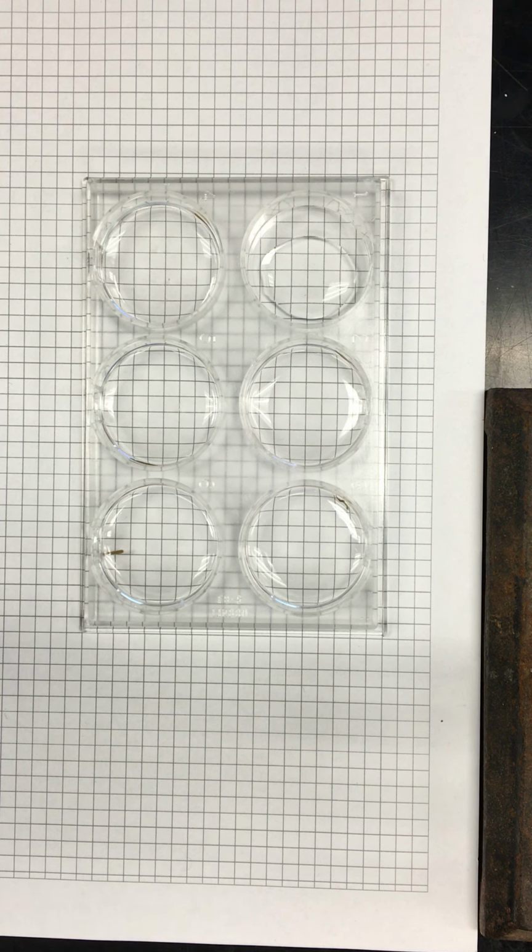Okay, sorry, you're right. That's why... okay, so my calculations are looking fine. My bad. So 10. So yeah, you diluted it tenfold. Sorry, my bad. So you're diluting it tenfold, and then you're doing tenfold lower than that. So you're doing 10, 1 millimolar, and 0.1. That's fine. Yeah, and we're just making a little extra because we're using this solution to make that one and that one to make this one. Correct. All right.